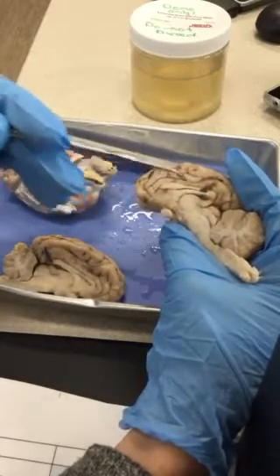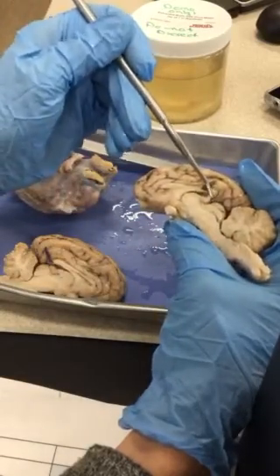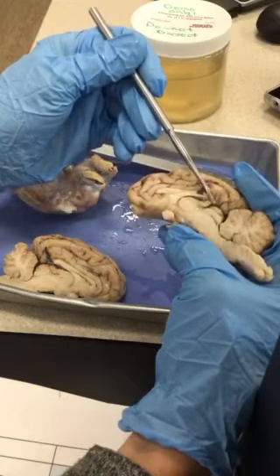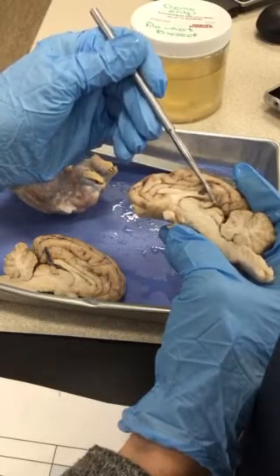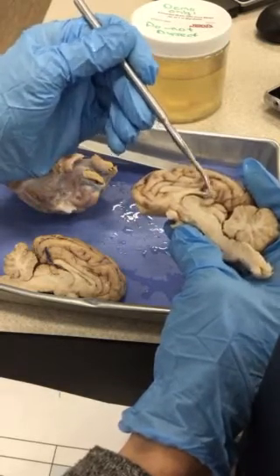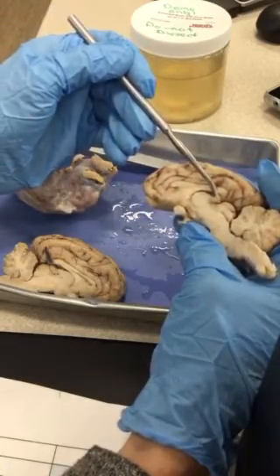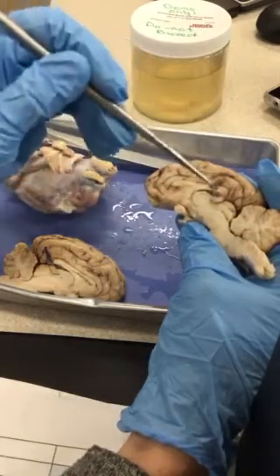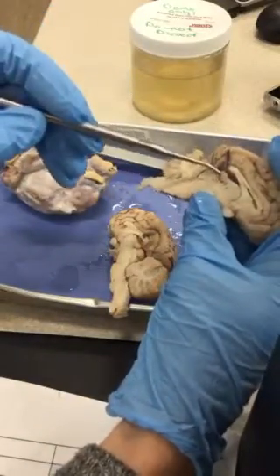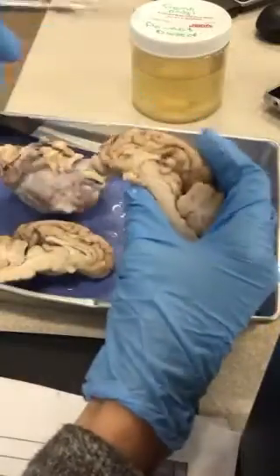So lateral ventricle, third ventricle, thalamus, and then coming off like a little ponytail off of the thalamus is this gland. Remember what the name of this gland is? Yeah, pineal gland. Somebody thought it looked like a pineapple shape. That's where it got the name pineal. But it looks like a little ponytail coming off of the thalamus. It's the pineal gland. And depending on how you cut it, you may have missed it, and it might be on the other side, on the other view. So that's the pineal gland.